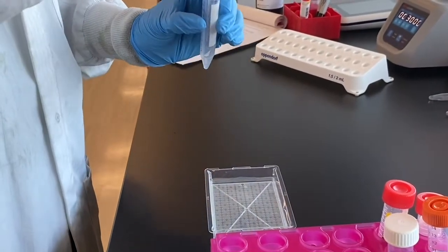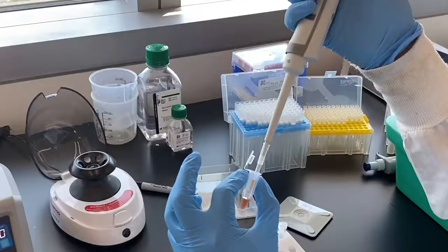Next, we transfer the pooled PCR product into a conical tube and vortex.